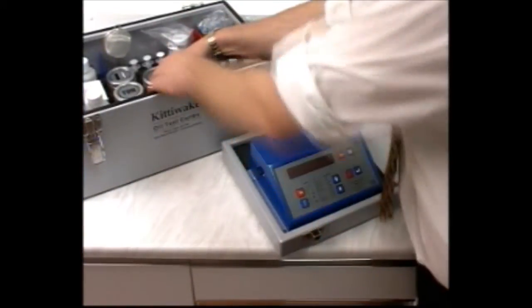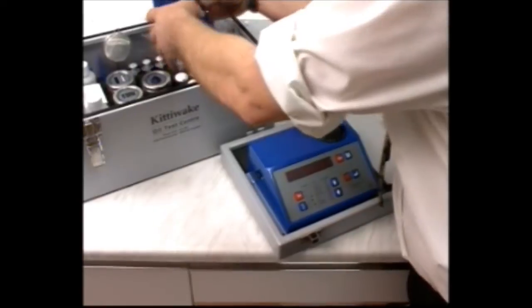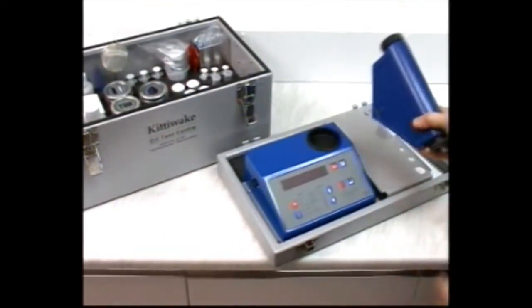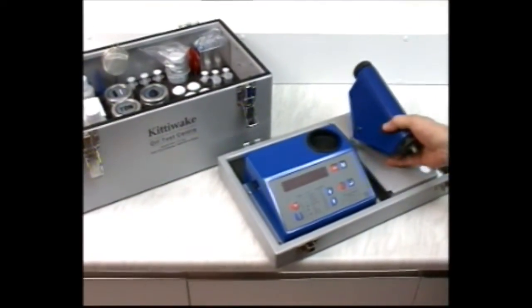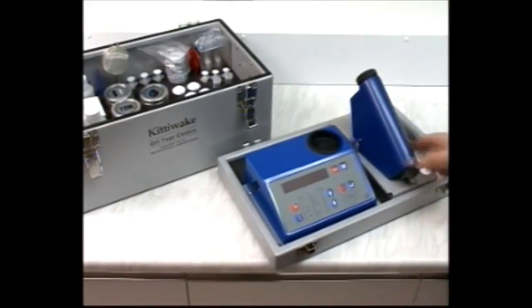This section shows you how to calculate viscosity at 40 degrees Celsius and 100 degrees Celsius, the SAE range, and the oil temperature.